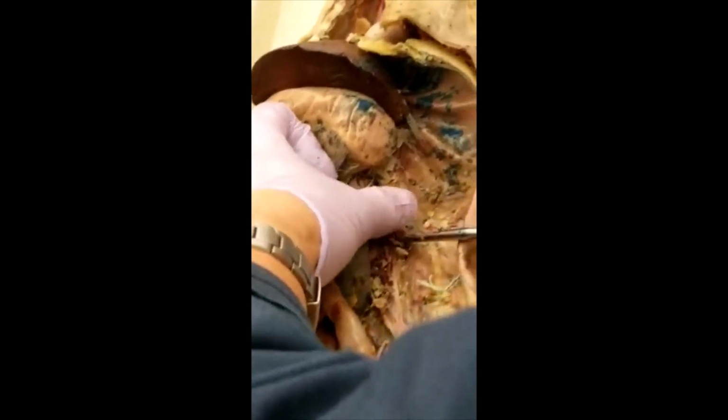I said you can find this. That's the adrenal lumbar, because the adrenal gland is over here. The adrenal lumbar, you see the branch here. The one branch going up, this one, supplying the diaphragm. That's the phrenic. Okay, that's the adrenal lumbar. See that? Very clear, right?